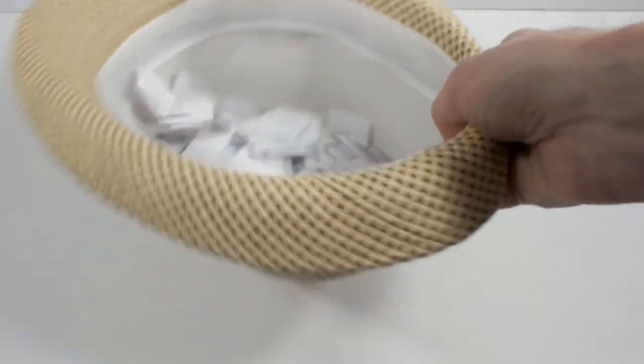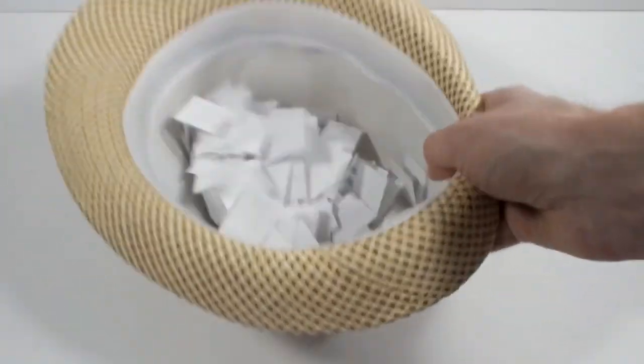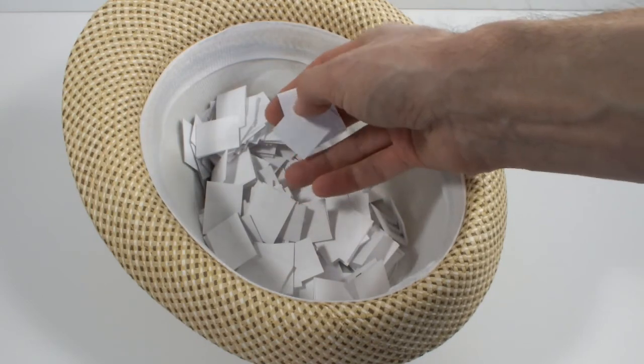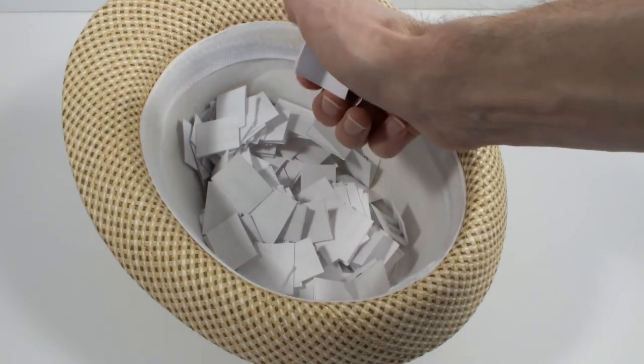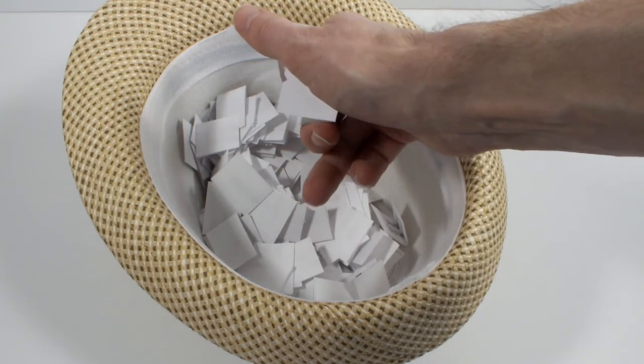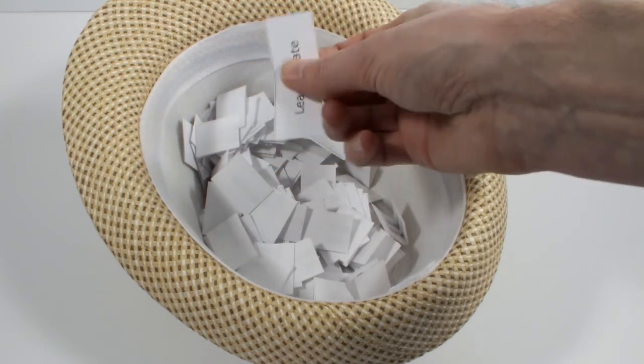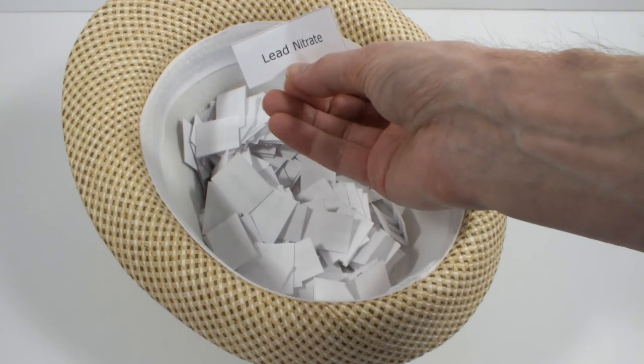So, maybe someday we'll see it again. But for now, the next challenge is going to be... There's always more than one, every single time. Lead nitrate.